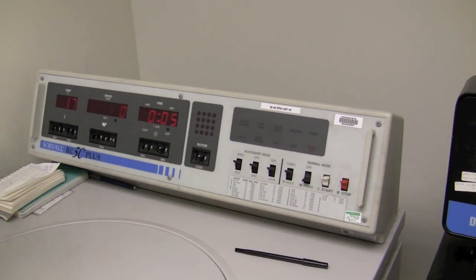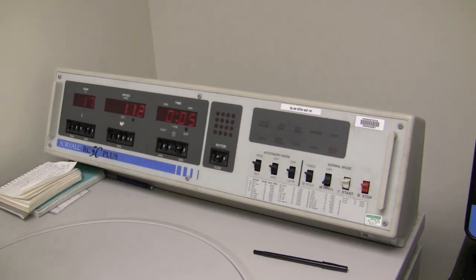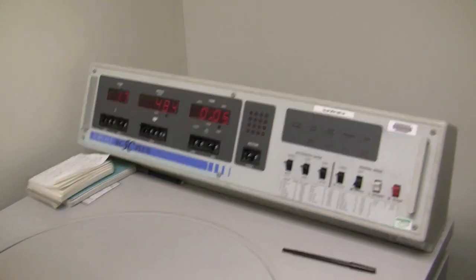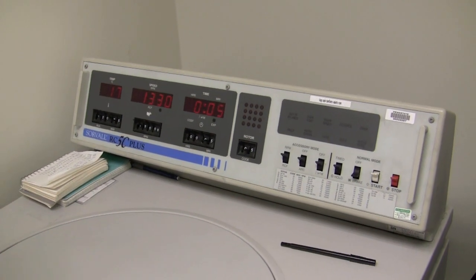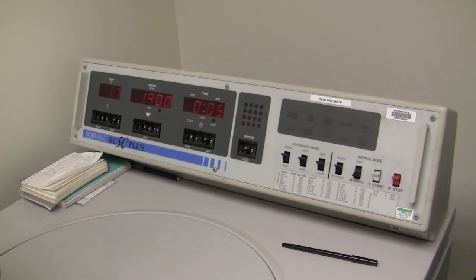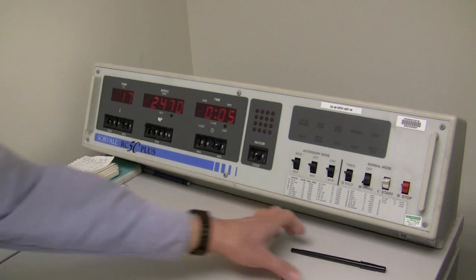I'm going to start. The rotor code will flash to remind you to double check that you've got the right rotor code. It's a good idea to stand around for the first few seconds to make sure that there's nothing unusual that's going to happen.